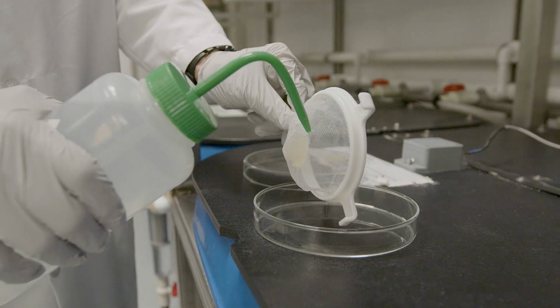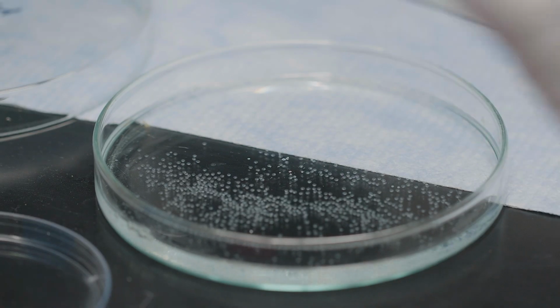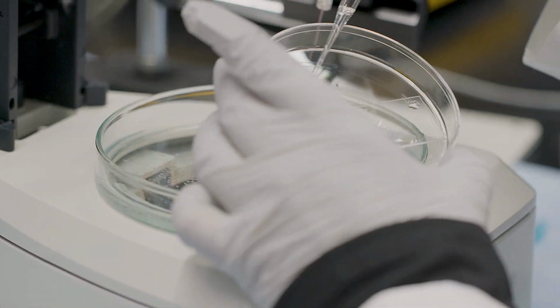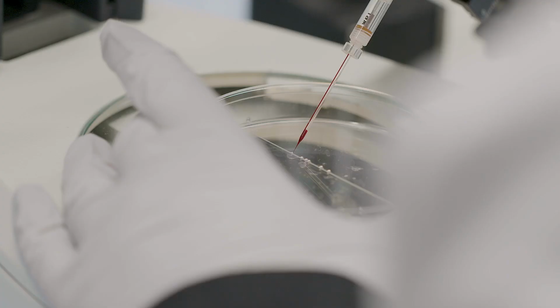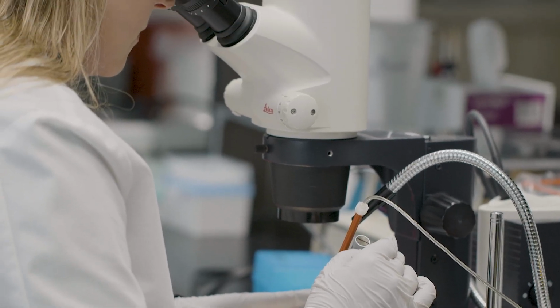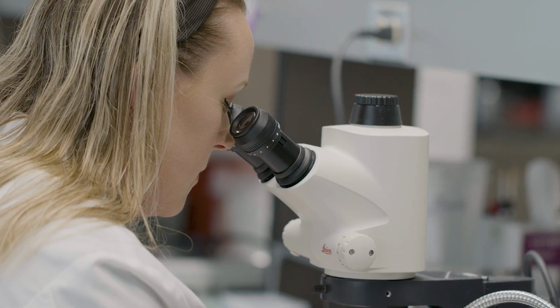So the zebrafish represents early embryonic development, the most complex period of an organism's life stage. The scale that the Tanguay Lab does things at is unmatched, certainly in any sort of organismal research. They do things at such a grand scale, and it's so repeatable and reproducible. For a person like me who brings their bioinformatics and statistics toolbox, it's like a playground almost.